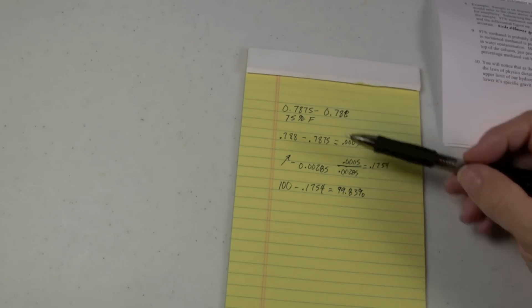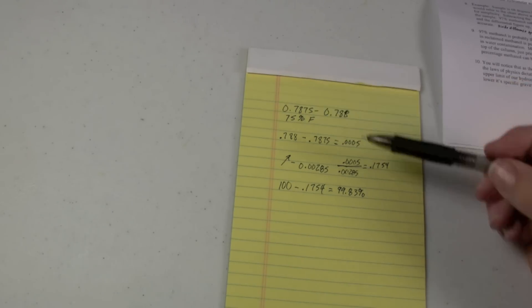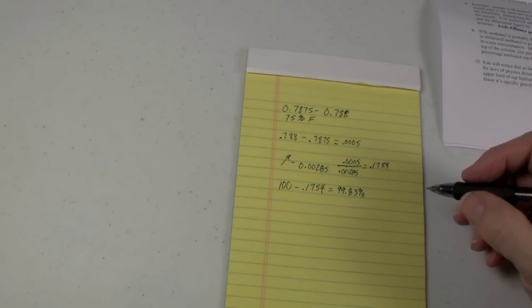In reality, we were closer to this number, so we're probably pretty darn close to being absolutely pure, 99.9% pure.